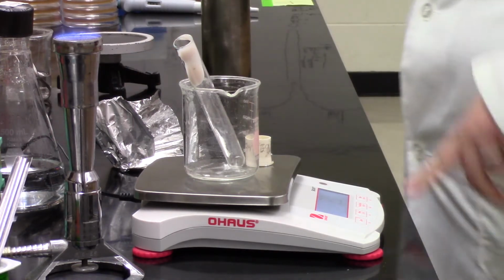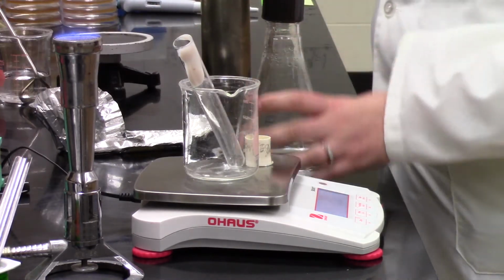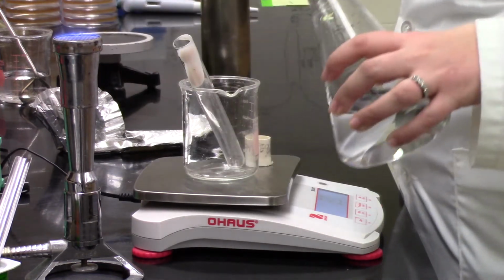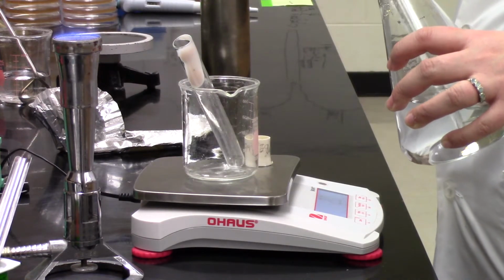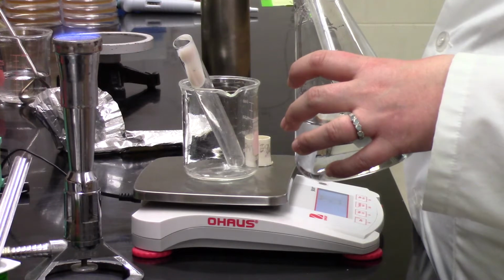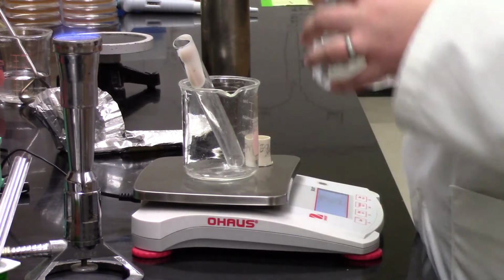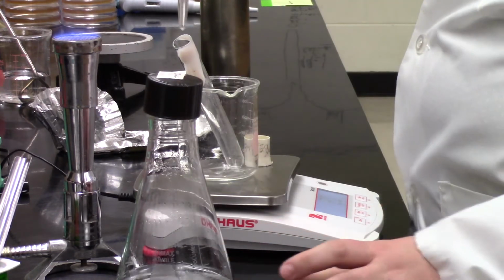And once she's got 2 grams in there, which it looks like she does, she's now going to rinse that yogurt down into the bottom of the tube with 5 mLs of distilled water. There's obviously a little extra volume from the amount of yogurt, but it's going to give us roughly 2 grams of yogurt in a 5 mL distilled water sample.